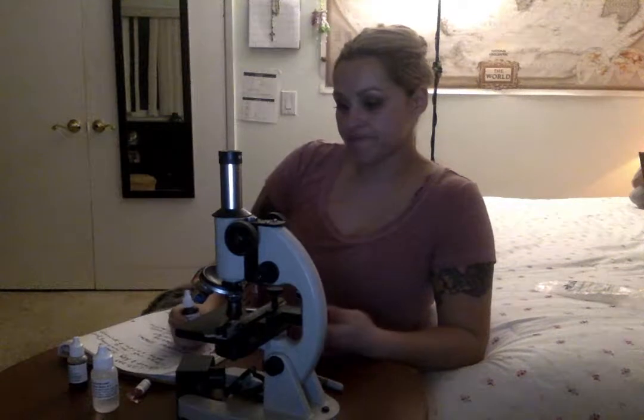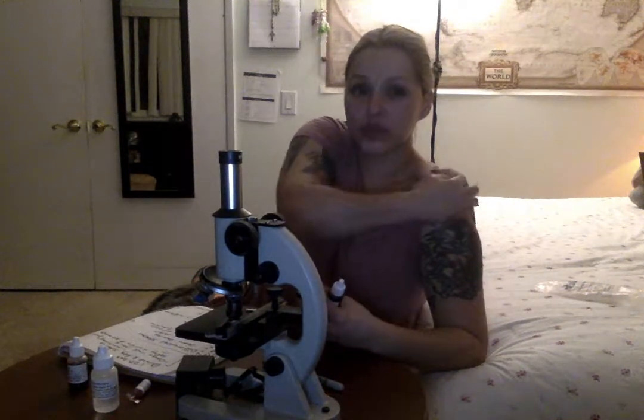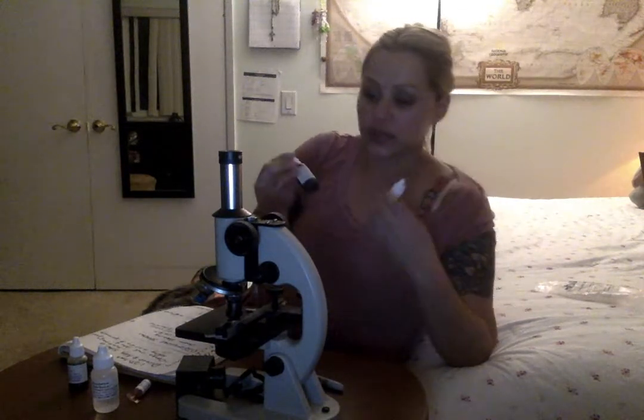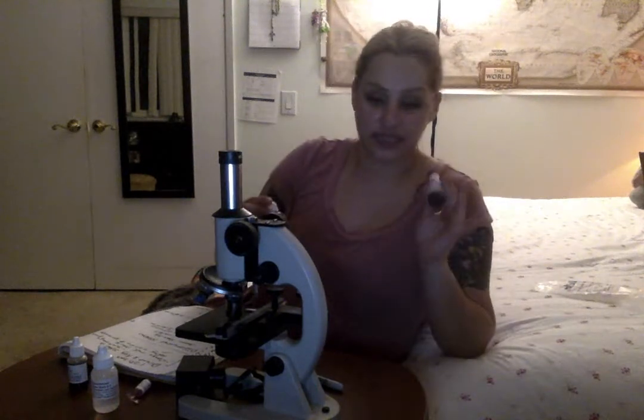At the end of the lab, I think the best slide that I had that showed most of the structures was the E. coli. I just saw more vibrant colors, and I can see the two different structures, the crystal violet and the safranin. So that was my observations there. All three of them are really interesting, and I was able to see different cells and organisms, and that was really cool to see.